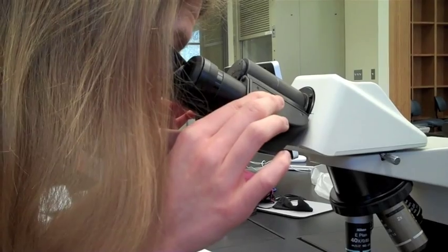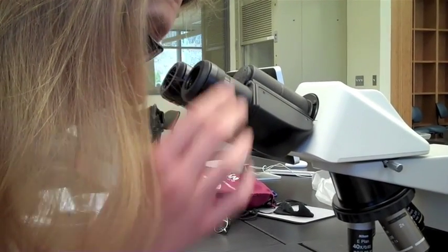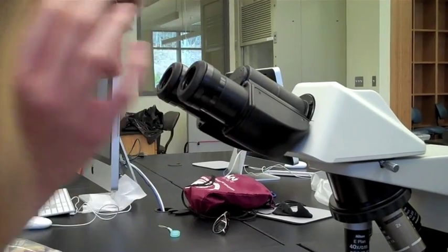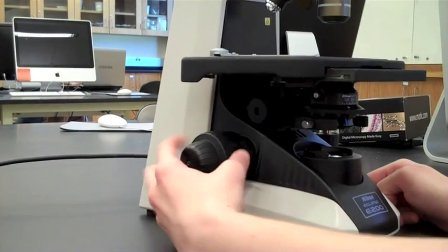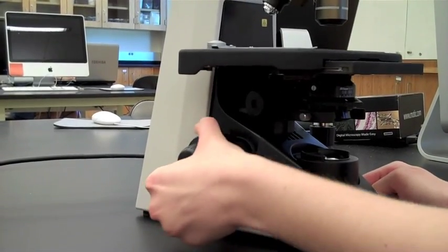Adjust the width of the eyepiece for comfortable viewing. Focus each ocular lens. Use the coarse and fine knobs to focus your slide.